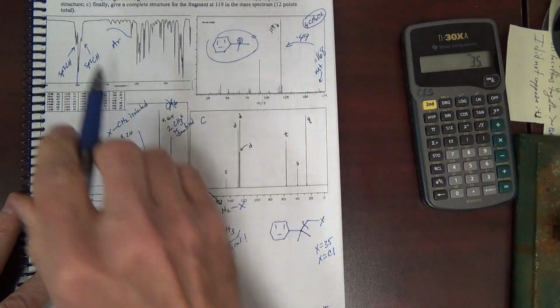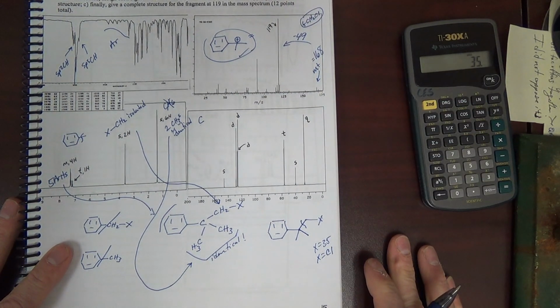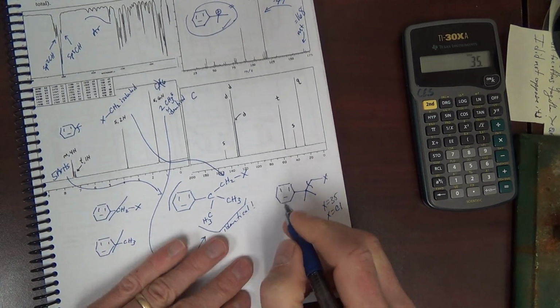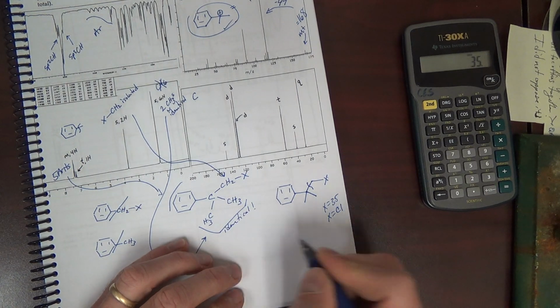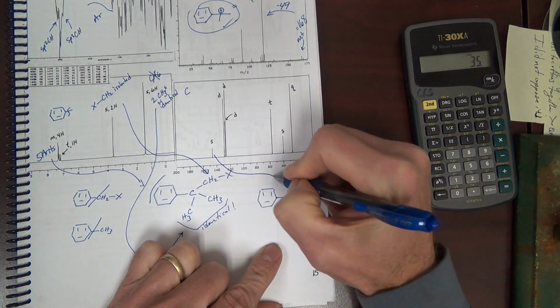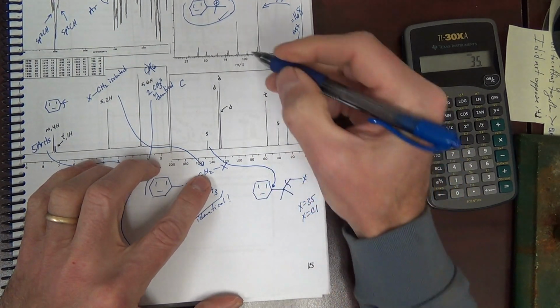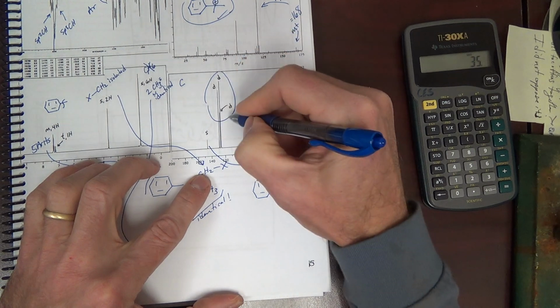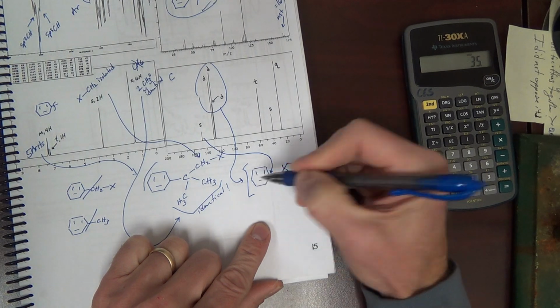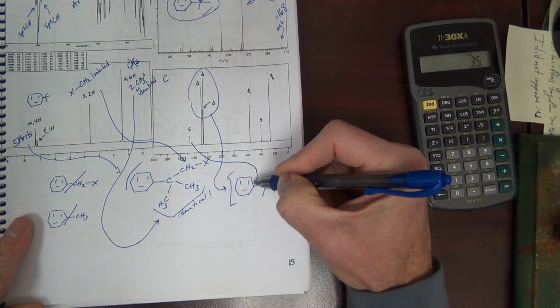All we need here is a complete structure for the fragment. That's what we need. Anything else? Just discussion. We need to assign carbon NMR. Singlet would be this guy here. Short peak, it's also a singlet because there's no H. These three signals are the remainder of the ring. Boom, boom, boom. I don't know which is which. Each carbon would be a doublet if we had splitting, because each carbon has one H.